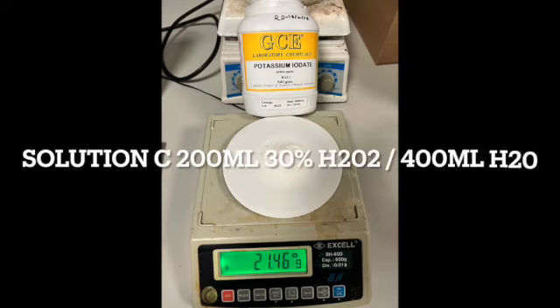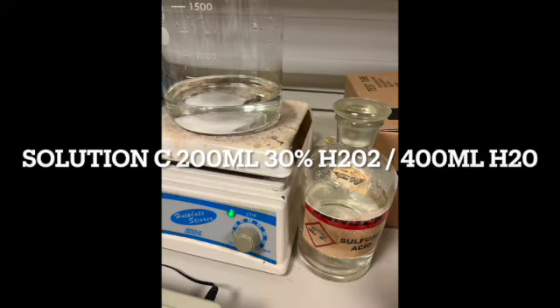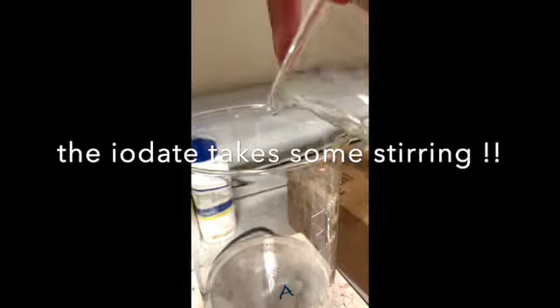Solution B, they all dissolve together. Don't forget to dissolve the starch before you throw it in. The iodate does take some stirring.